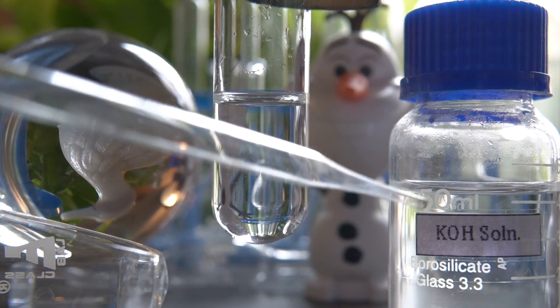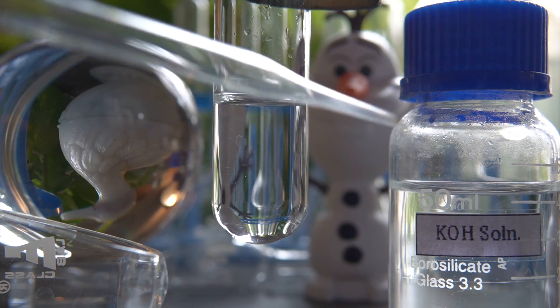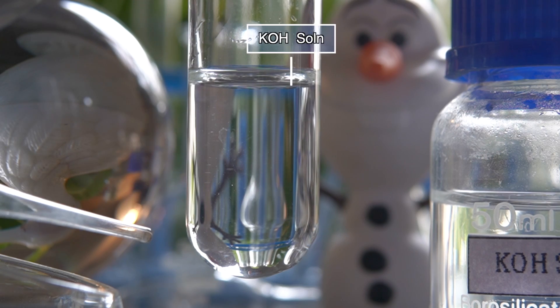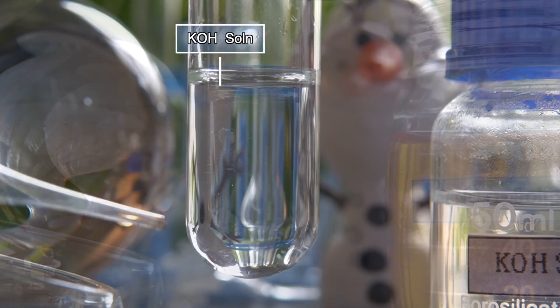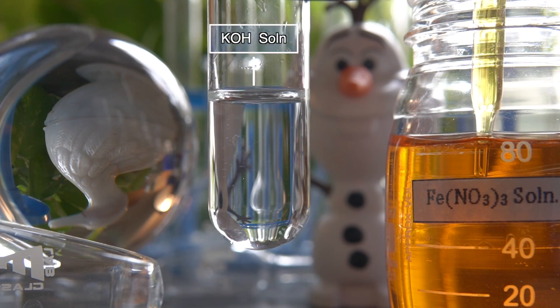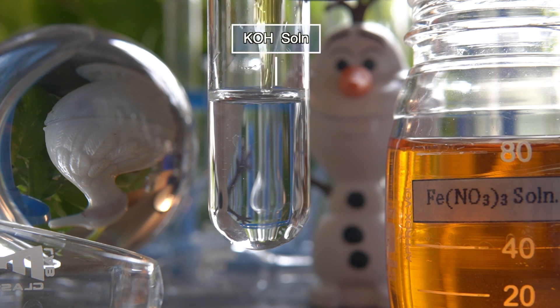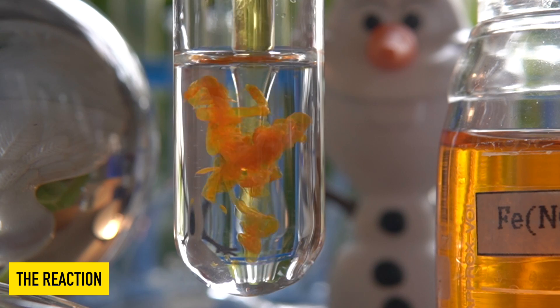Now to initiate the chemical reaction, we will take some amount of colorless KOH solution into this test tube. We will then add iron 3 solution into the colorless KOH solution slowly and observe the effects.